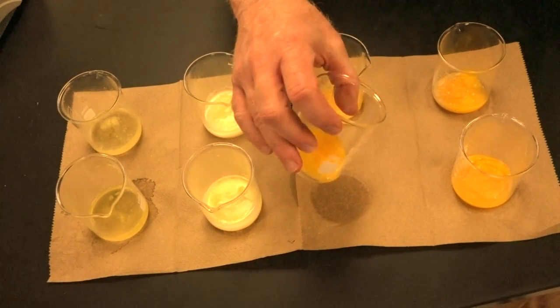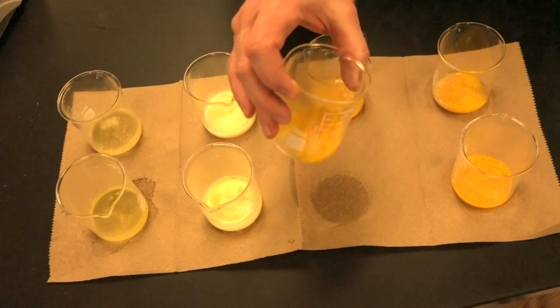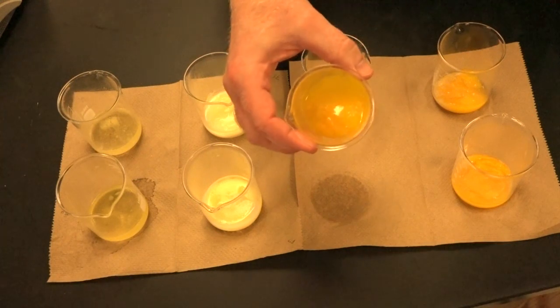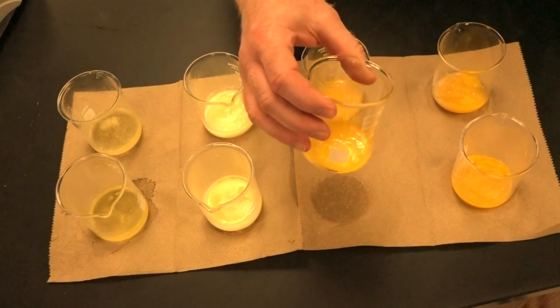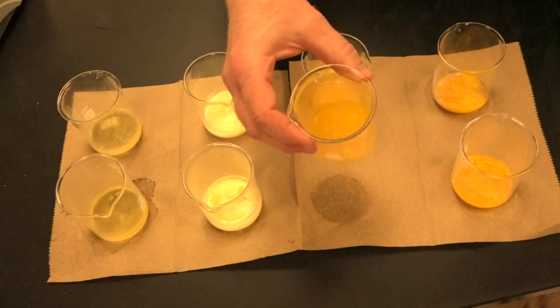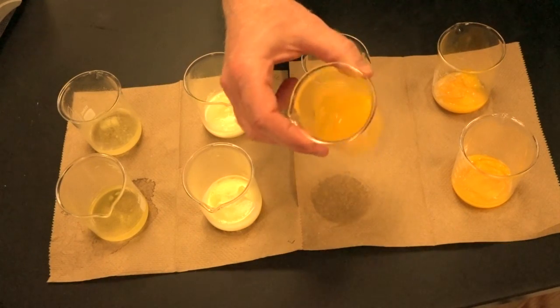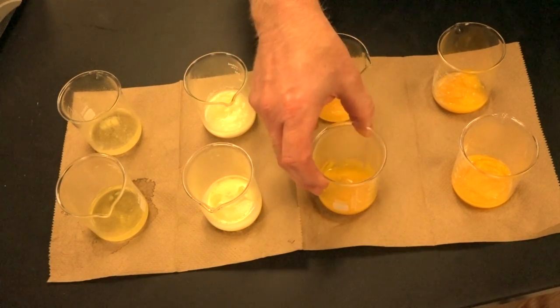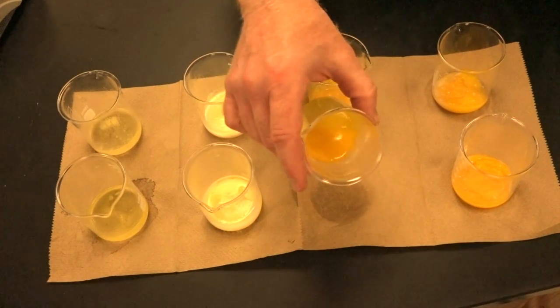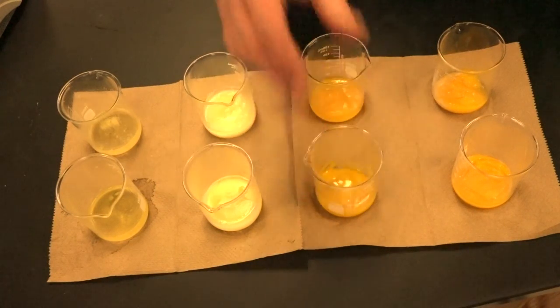So here's our 60-degree yolk. Notice it's very, very much runny right here, right? The top's drying out a little bit. But these, of course, because of the coloring in there, definitely this is opaque. No light's passing through there and you can't see through it. So that's just a little bit of help with that word. Of course, you hopefully used some opaque over here a little bit as well, right? But you can see that this is really primarily still liquidy, not much denaturation happening at 60 degrees.